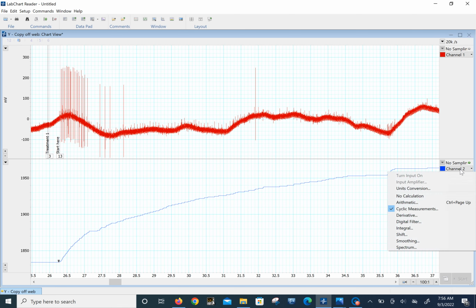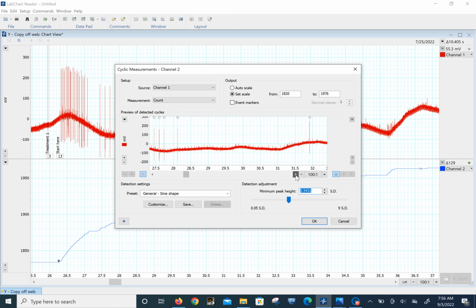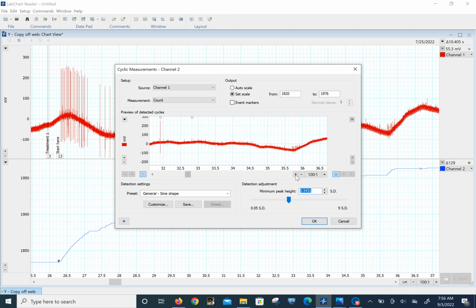So we go to channel 2, cyclic measurements, and we see our traces. This is the 26.5. Make sure this is right. This is 26.5, yes, so we're right on. We can hide that little trace. Now we can see what spikes we want to count. Then you can change the setting, right? And we can say, let's just count the big spikes, for example. Here's 26.5, so we know we have to go to 36.5. If we scroll on down here to 36.5, this is where it ends.